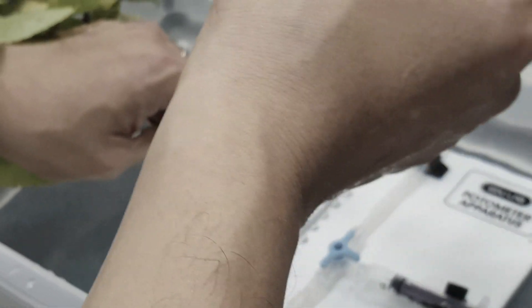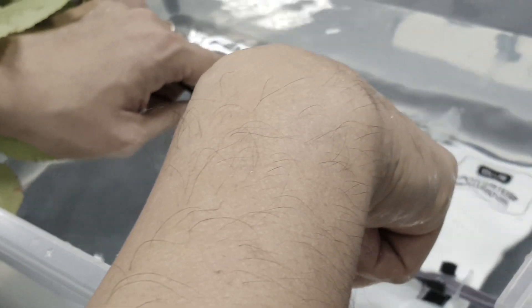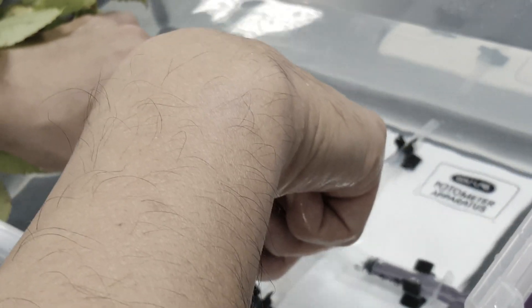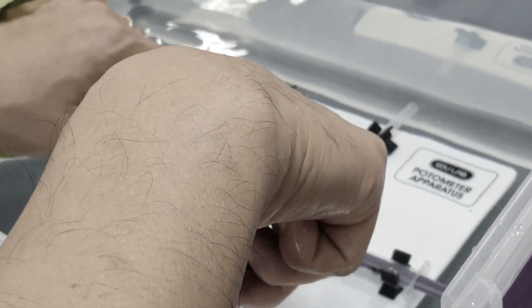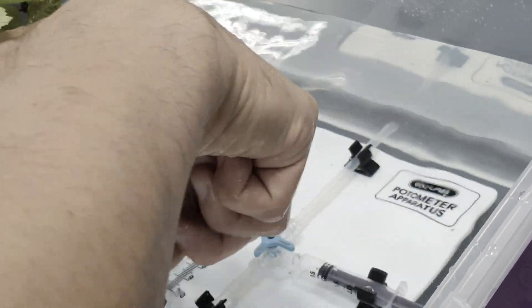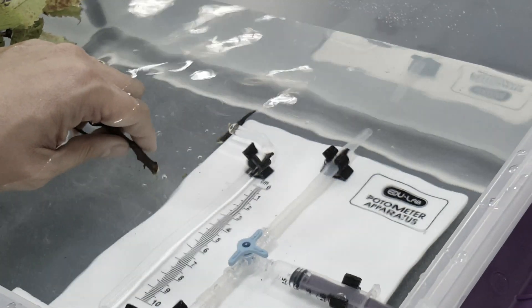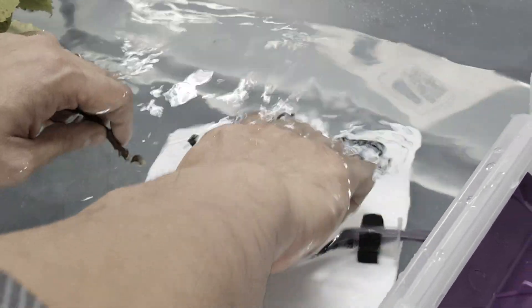That's on your quiz, make sure you know that cohesive property. So you want to have water in this slot here that you just cut, okay, so it can draw the water up. So you cut the stem inside while still in the water.